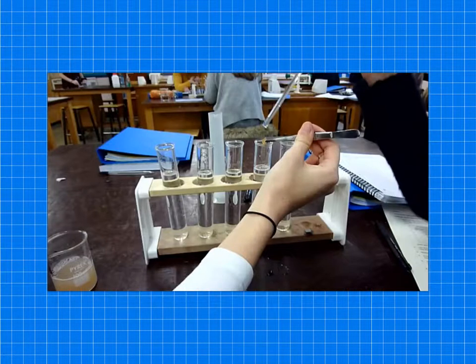So once they had the card, they would need to drop the card into the boiling tube. Now the problem that we had was that the card seemed to float very easily. So I don't know whether that was the thickness of our card as it didn't fall to the bottom of the tube. But if it doesn't fall to the bottom of the tube, which it didn't, they needed to push it down with a glass rod. Now you'll see the difficulties of doing that. But this is the main issue with this experiment is that the card soaked in catalase, once it hits the hydrogen peroxide, reactions are occurring. But there is a large volume within the boiling tube, so we should be okay.